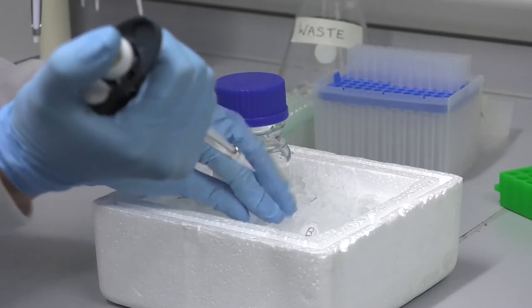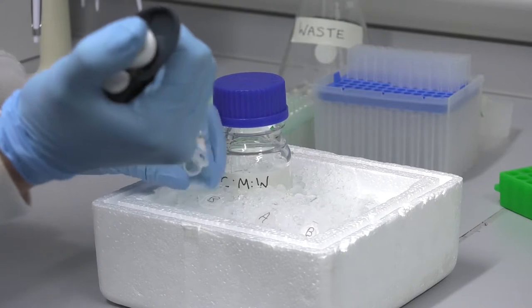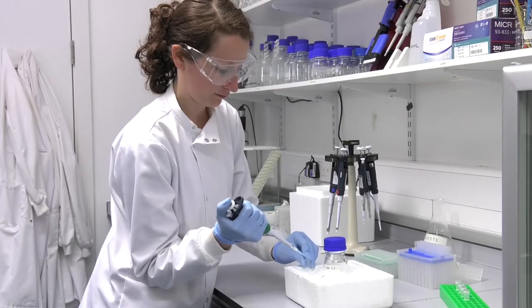Step 1. Take 25 microliters of each sample and add to a clean Eppendorf tube. Keep all samples on ice. Step 2. Prepare a pooled sample with an equal volume of all your samples.